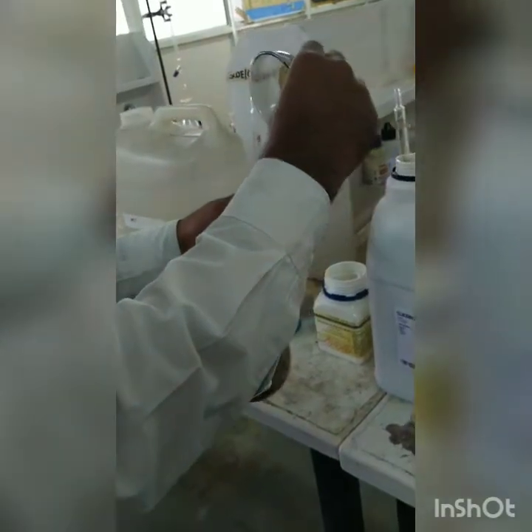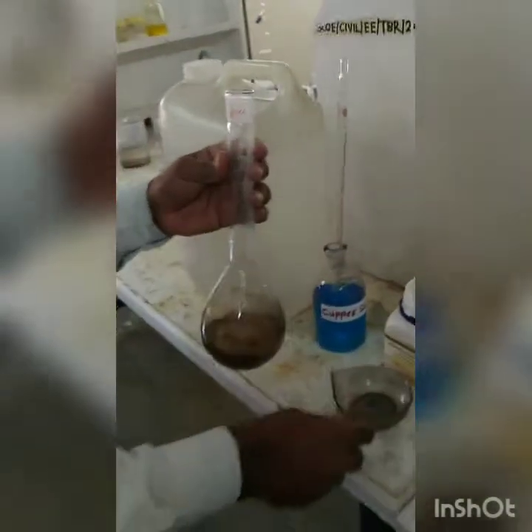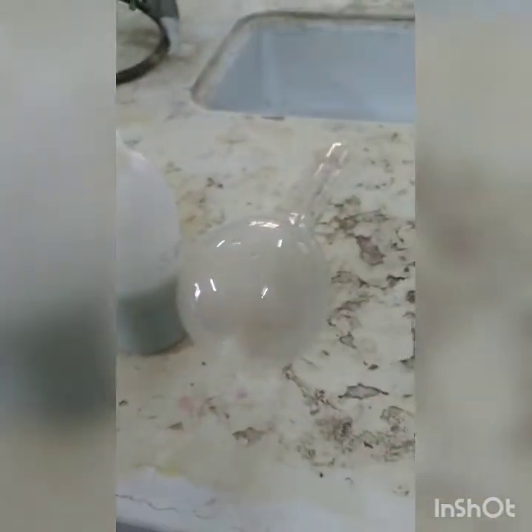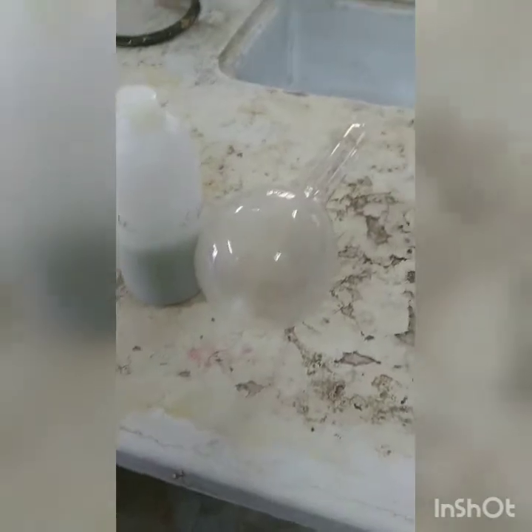So this is our total Kjeldahl digestion flasks. So similar flasks with similar contents will be prepared, one for our grey water sample as usual, and other we will run with distilled water. So you can see the one which is used for distilled water is very, very clear as compared to the digestion flask that we use for samples, because it gets color and everything developed in that, whereas distilled water being clean, this is comparatively clear.